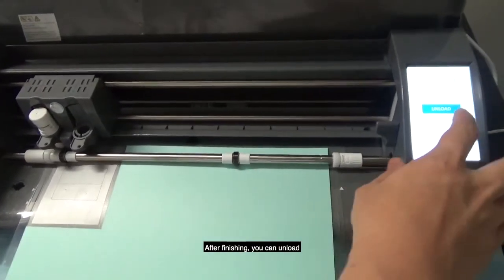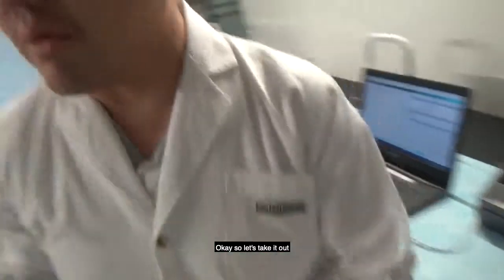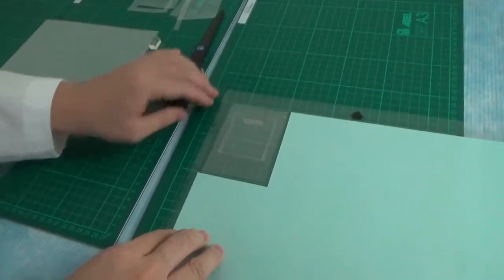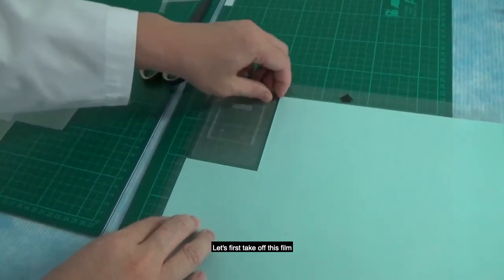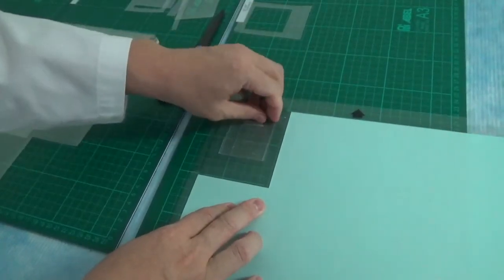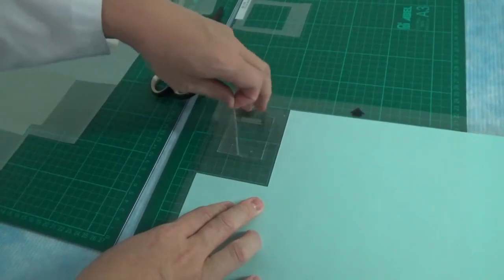After finishing, you can unload the cutting mat. Okay, so let's take it out. Let's take these stencils out of this film. Okay, so to take these stencils out, let's first take out this film. Right, okay. And then you can take these middle parts out.